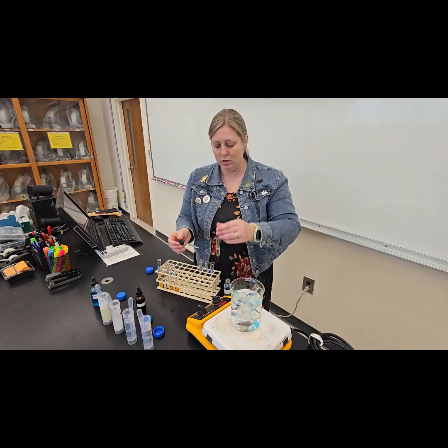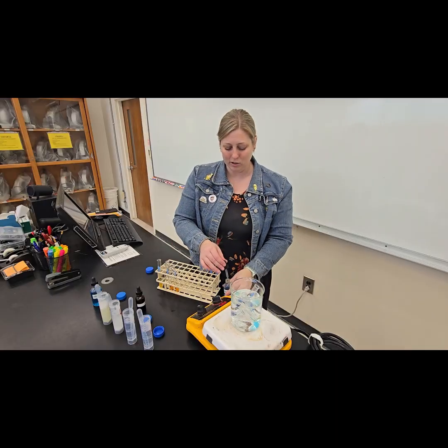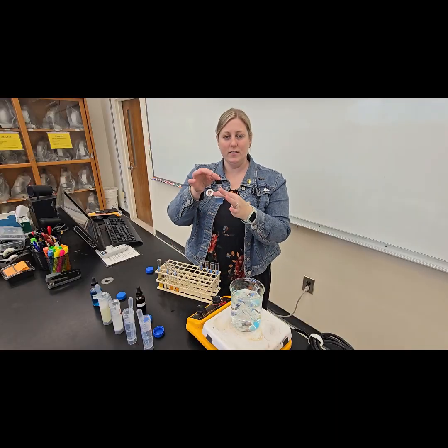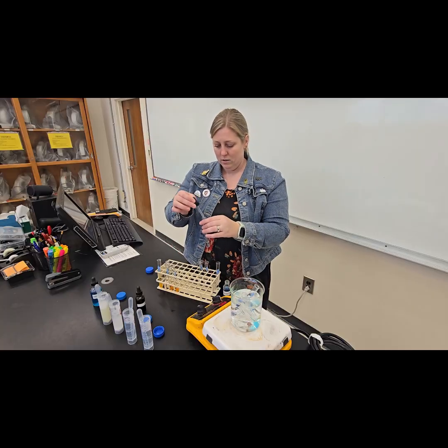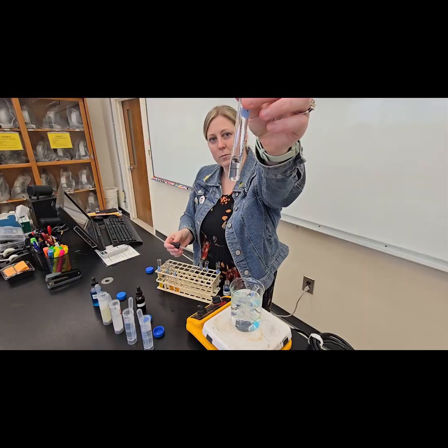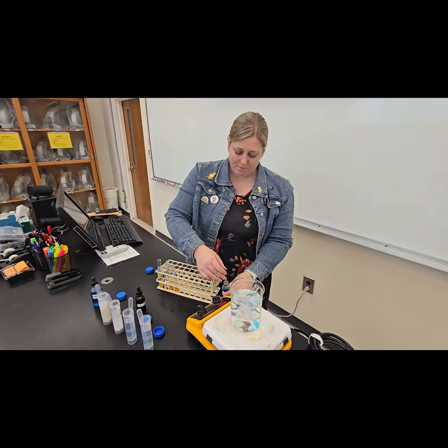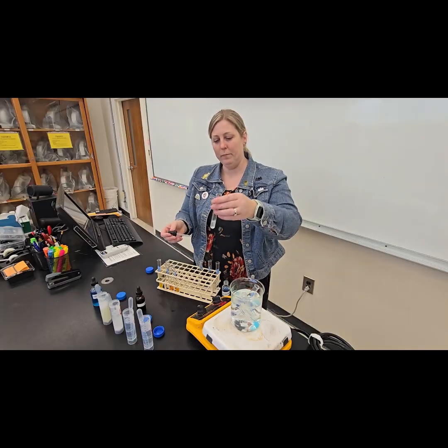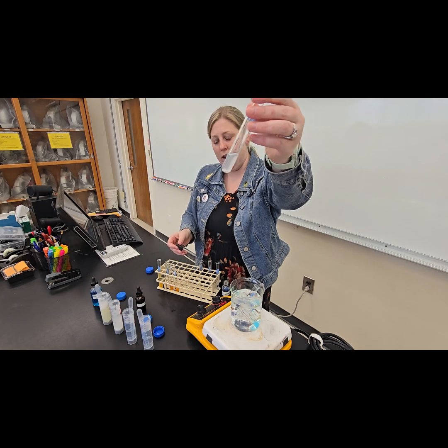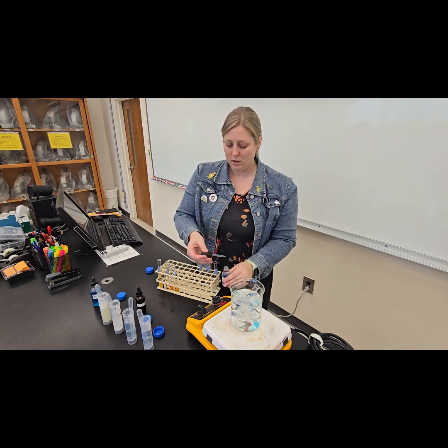Again, I would expect no color change. No color change. It's not going to even look like there's much color to it because the Biuret reagent is a very pale blue. It's got some copper in it. And again, no response with glucose. Perfect. Should stay kind of that clearish color. If you put it on a white or a black background, you might see a faint blue color. Starch, no reaction. Fantastic. That means we made all of these correctly.